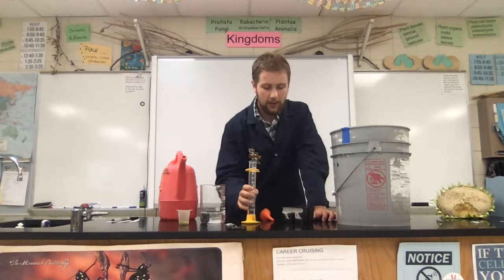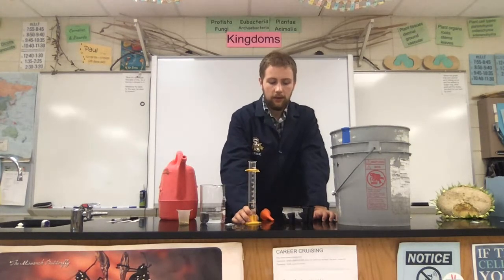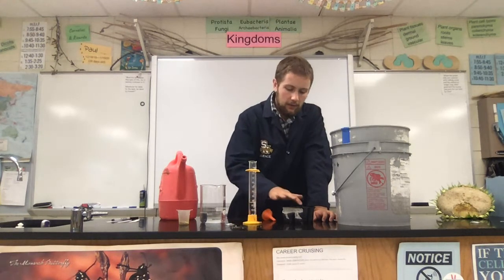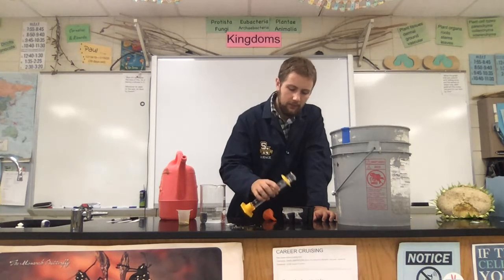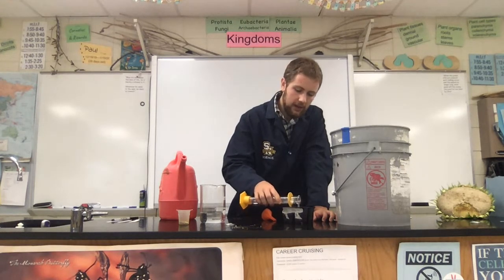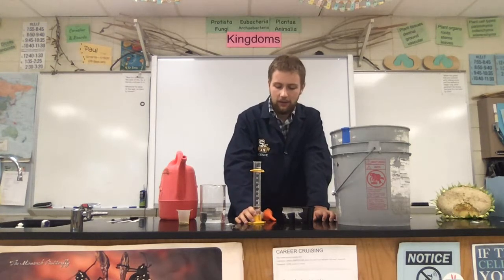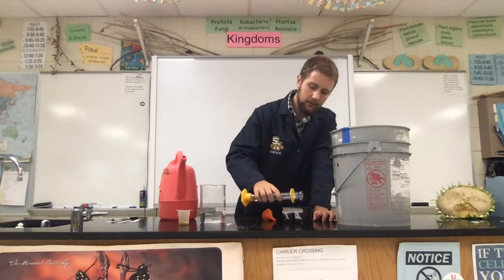Being careful to try not to get it to overflow into the other quadrants, because then that would throw off how much water was getting to those quadrants. So we'll water it, let it kind of settle. Water it again, let it kind of descend and settle. All right, this one's going quicker.